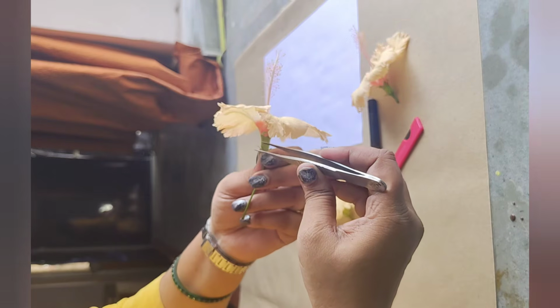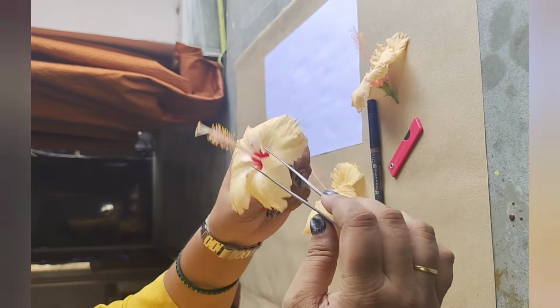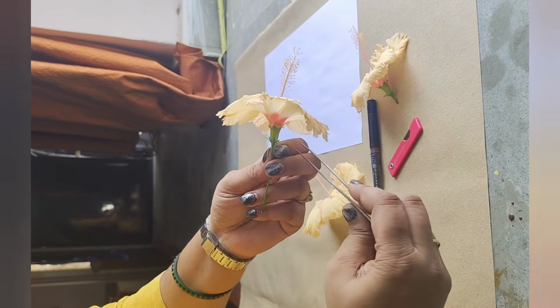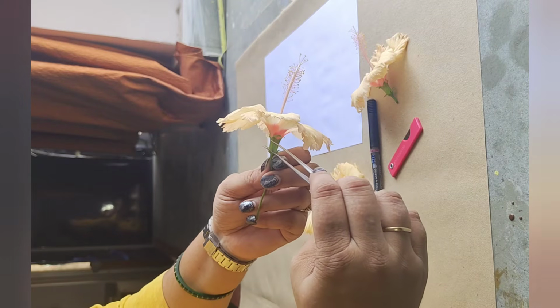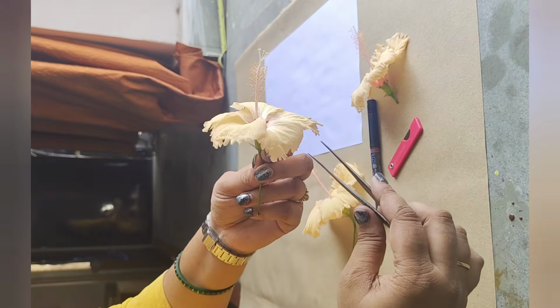After the epicalyx or the layer of bracts, we have sepals or the calyx, and after the calyx, we have the brightly colored corolla present in the flower. Corolla is generally brightly colored in flowers so as to attract the insects or the pollinators.